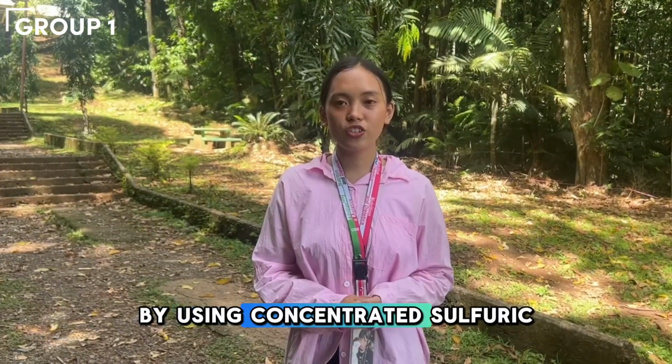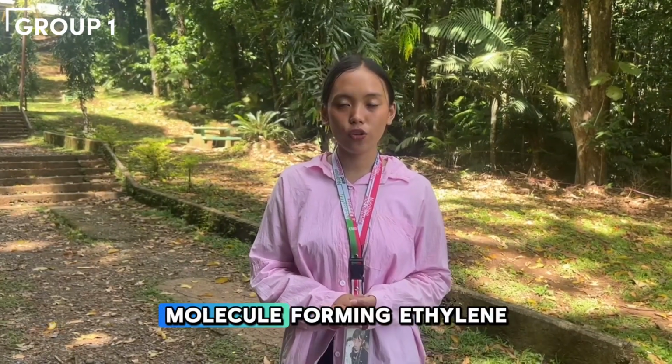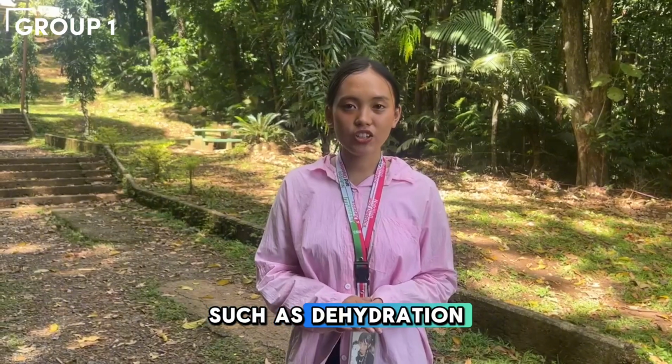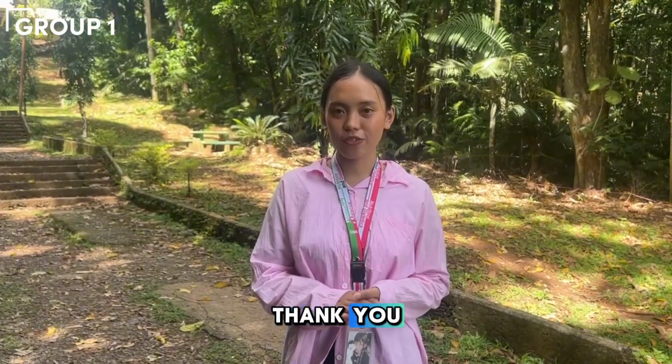By using concentrated sulfuric acid as a catalyst, ethanol loses a water molecule, forming ethylene. This reaction demonstrates key concepts in organic chemistry, such as dehydration and the formation of unsaturated hydrocarbons. And that is all. Thank you.